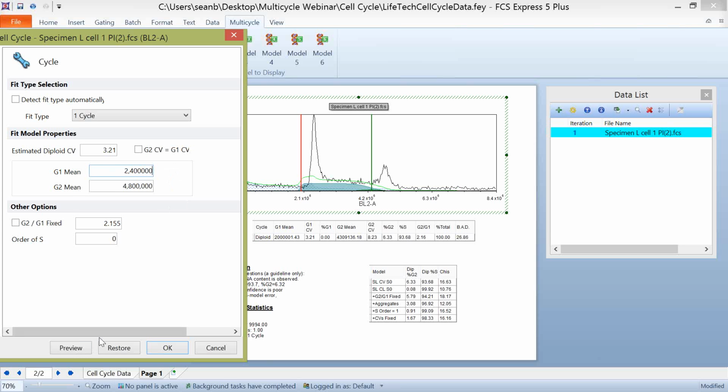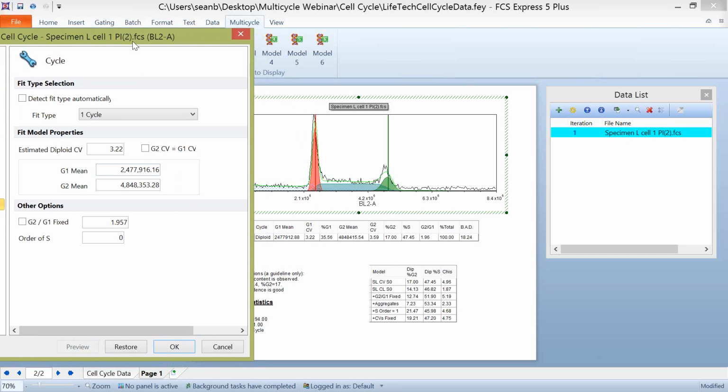And the one thing I should stress with this, the more that you change values within this multi-cycle formatting tab, the more you're getting away from the theoretical modeling of your data. So if you have to make changes for each of these sections to make something fit or work with your data, you may want to go back and have a look at that data and make sure that what you collected has been collected appropriately and that it can be appropriately fitted for that data with Multicycle.